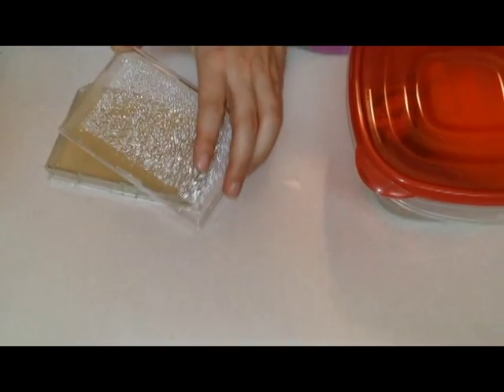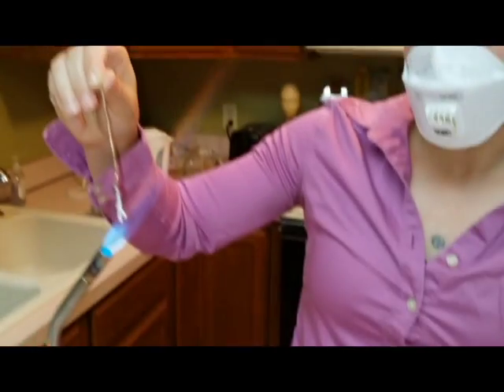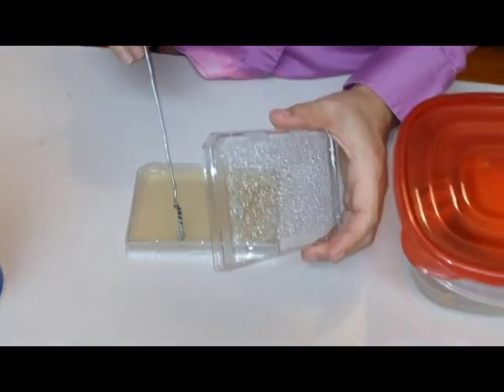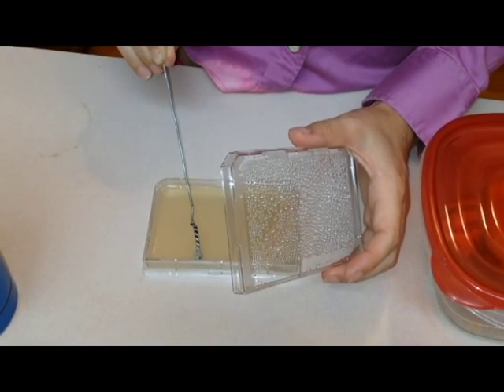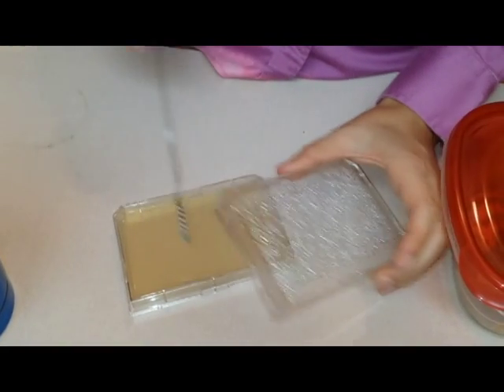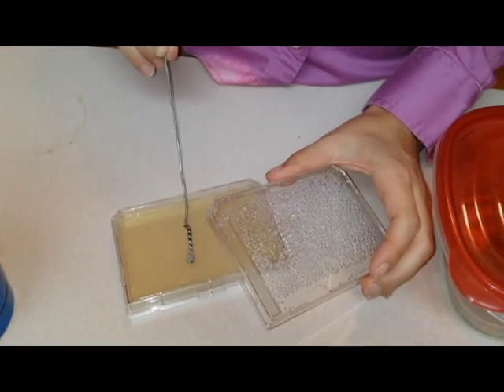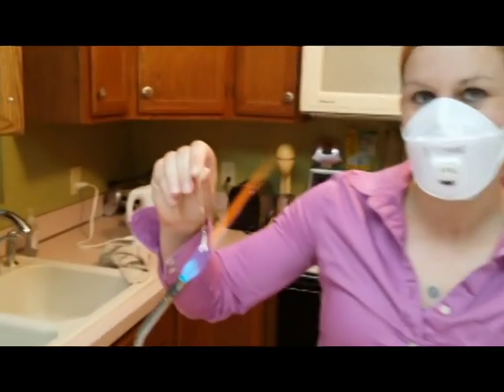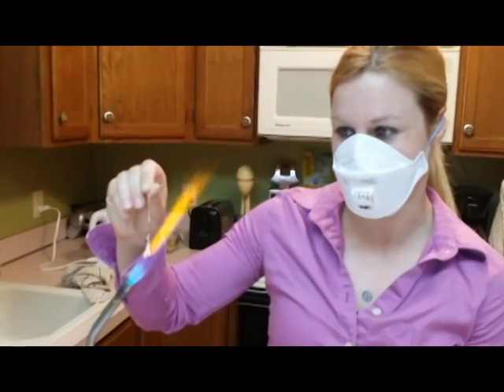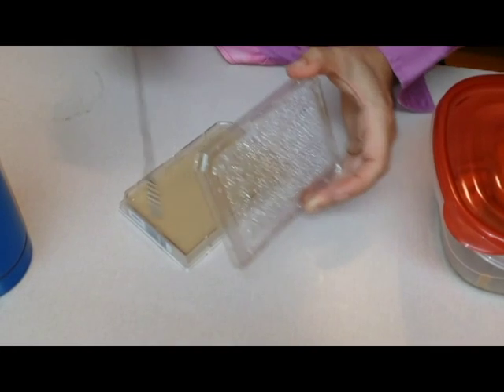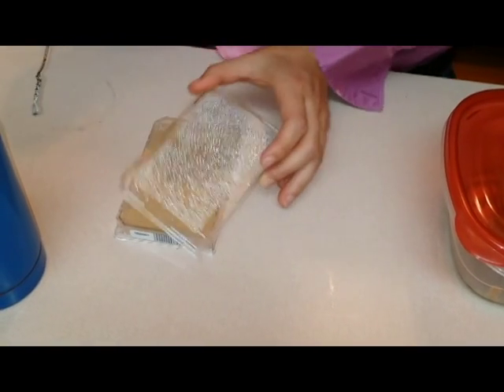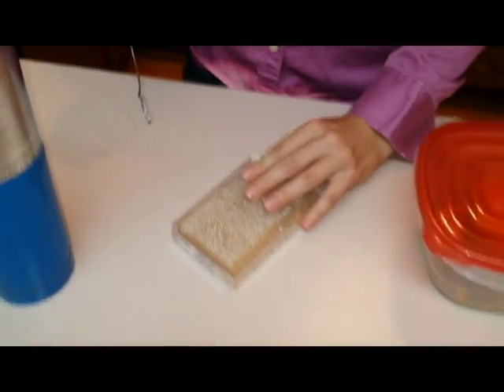Again, parallel lines. You've got to hit one, two, three. And just to be extra sure, we'll usually get single colonies there. One more time. And there you have it.